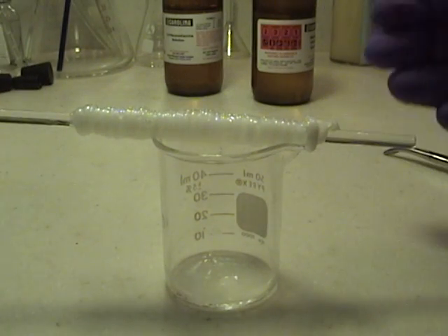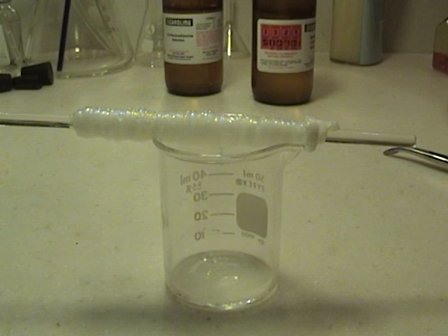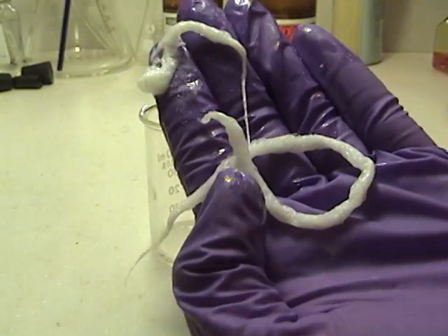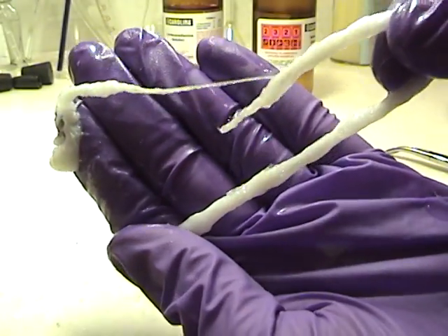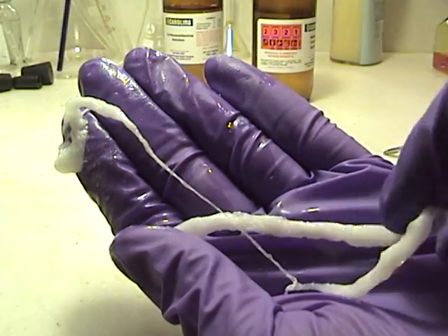And depending on how long you want this for, you can sometimes wash it and dry it out and keep the strand. But if you just leave it on the rod, then it will stick together and you won't be able to do anything with it. As you can see, I was not able to wash it sufficiently and I just pulled it off the rod and it is just a clump of nylon.